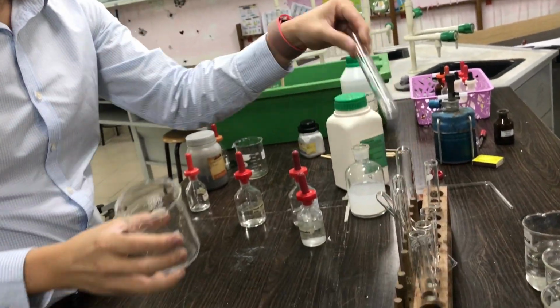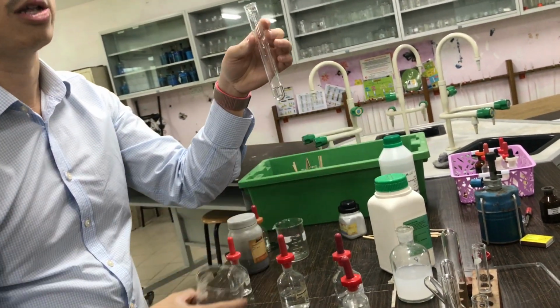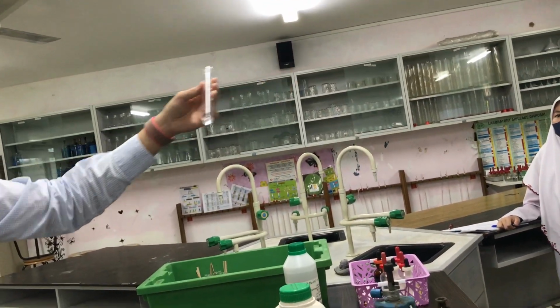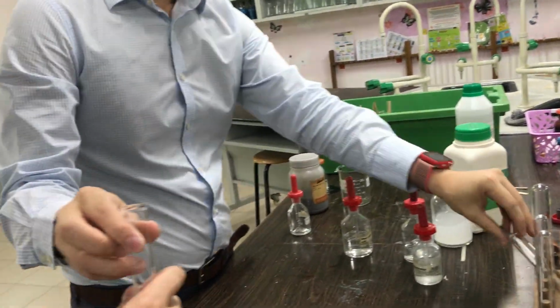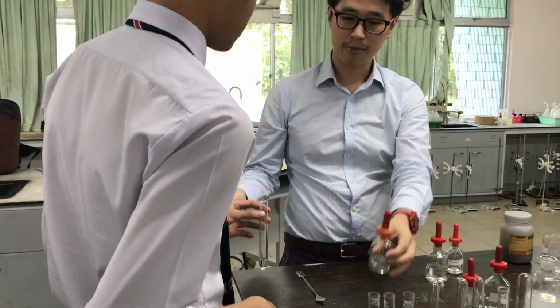Ammonium sulfate, yeah? So the solutions, if you see the test there, is solution, right? Aqueous, right? Aqueous means solution. Sulfate, okay? What's the first thing I do? But Iqbal, come. Right, what should Iqbal add first? Nitric acid. So Iqbal is going to add nitric acid.